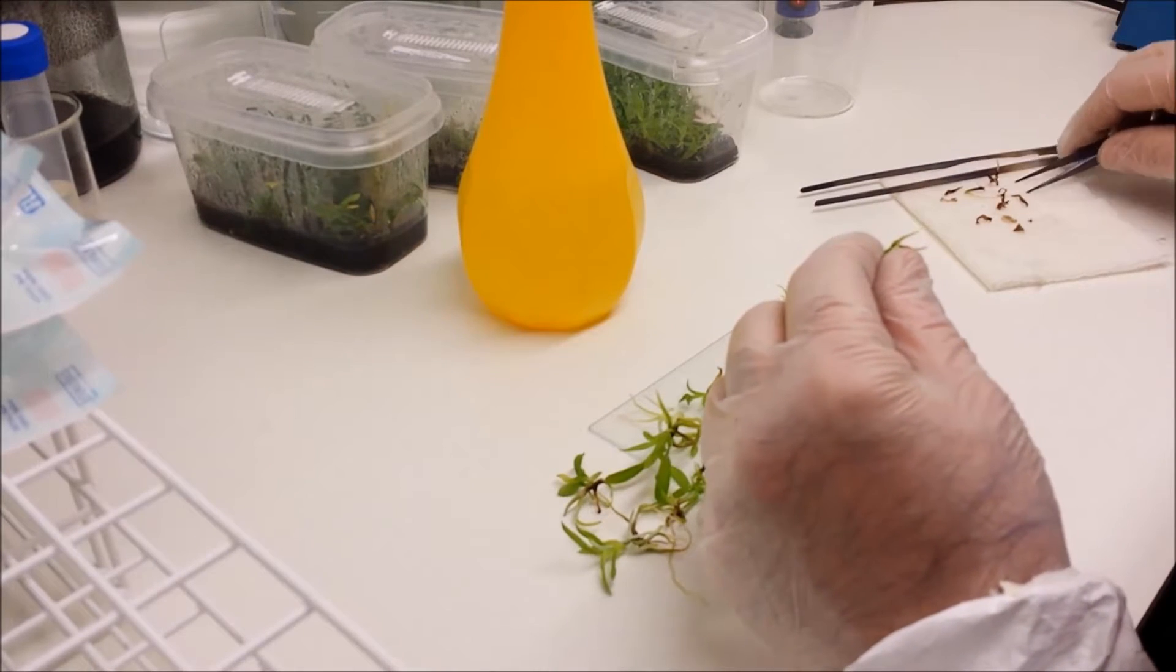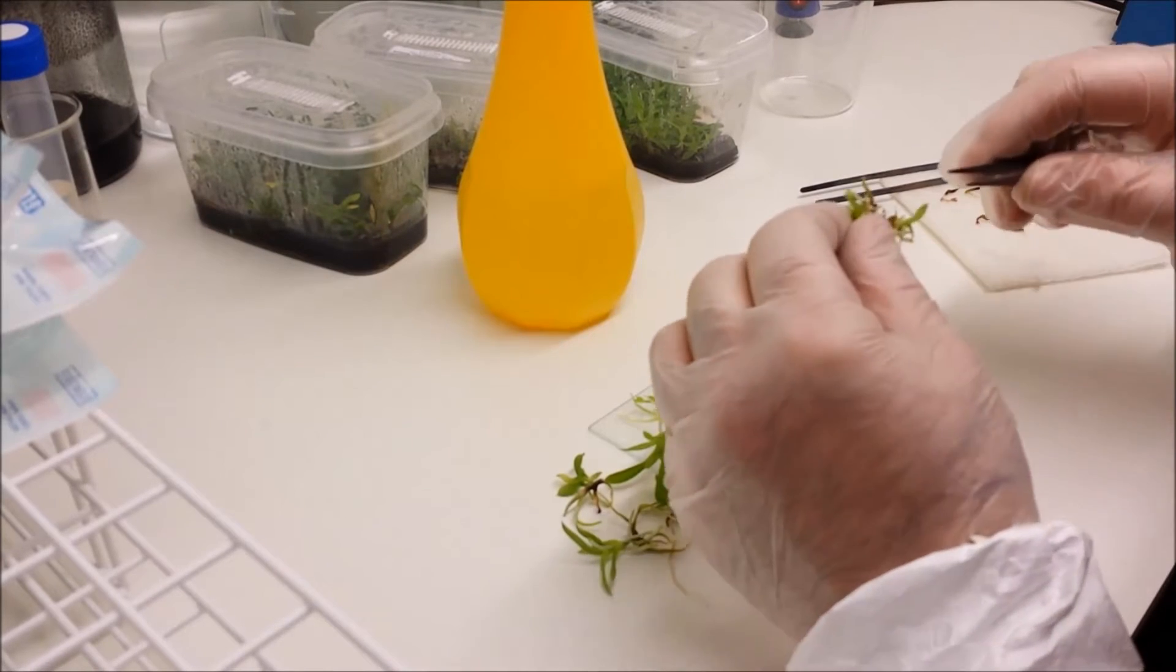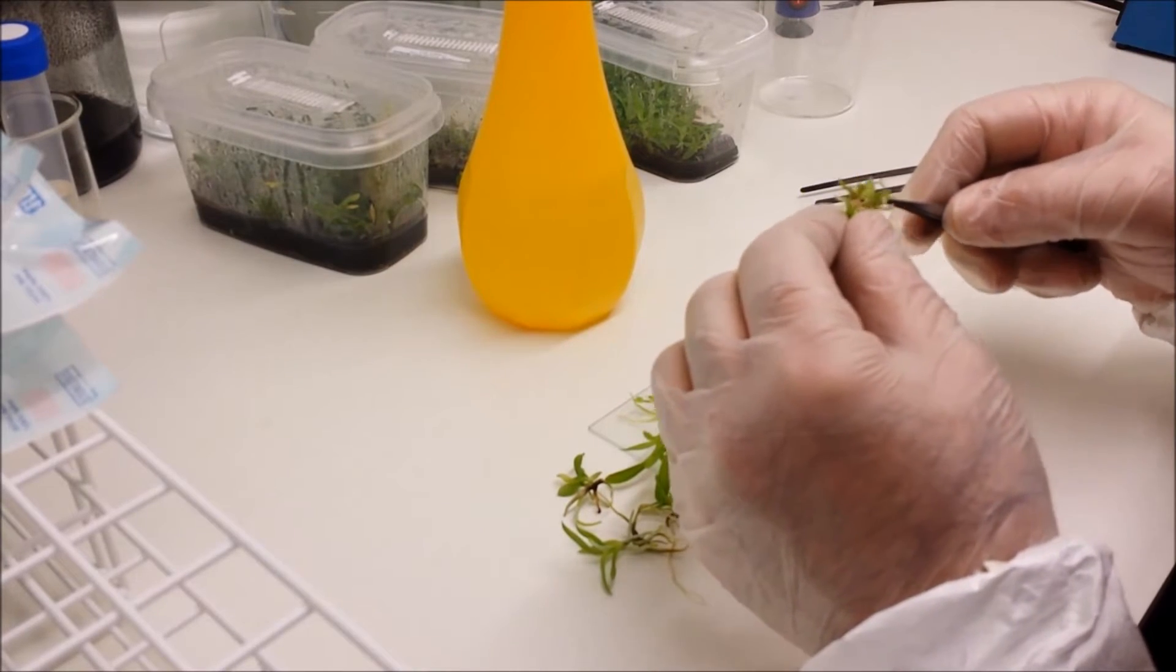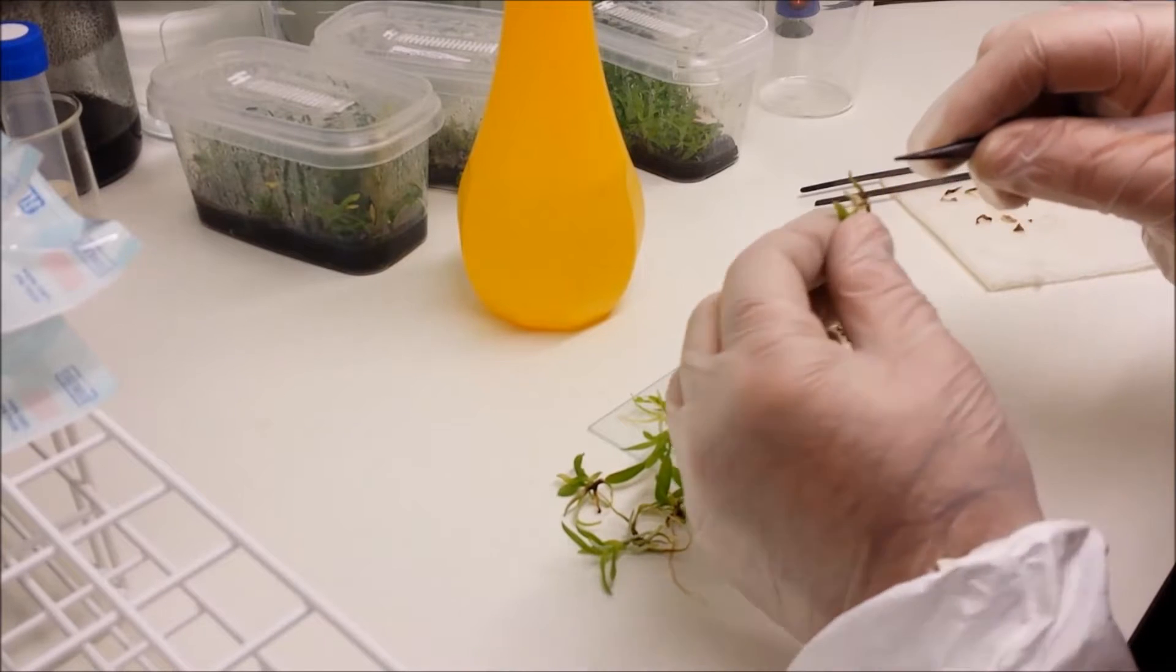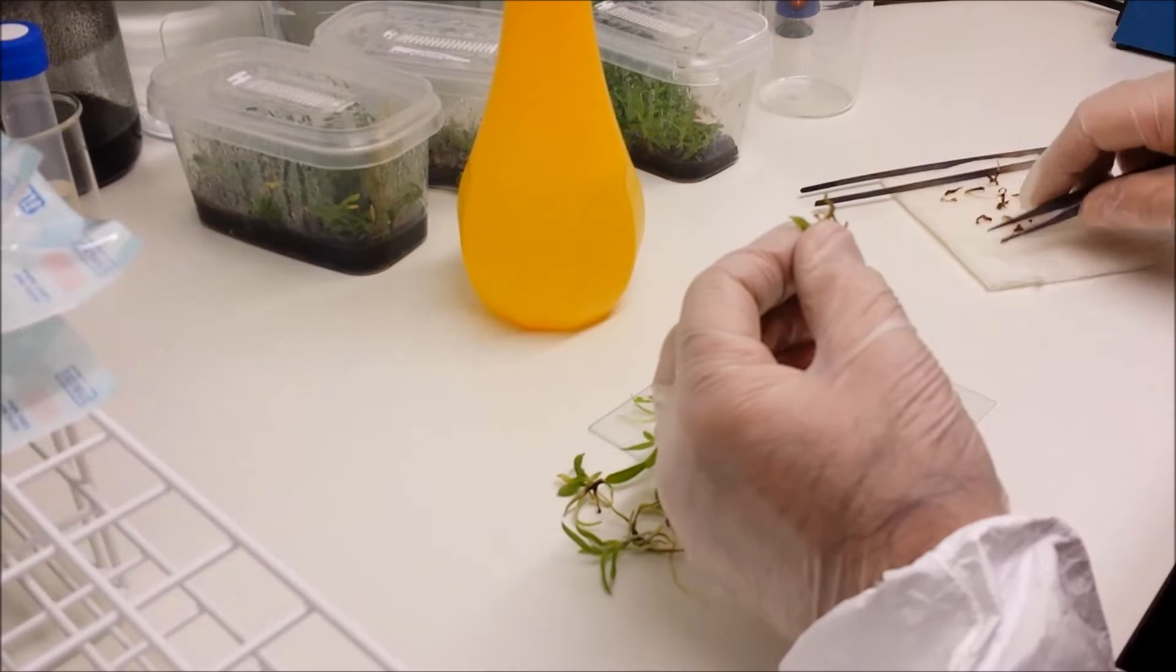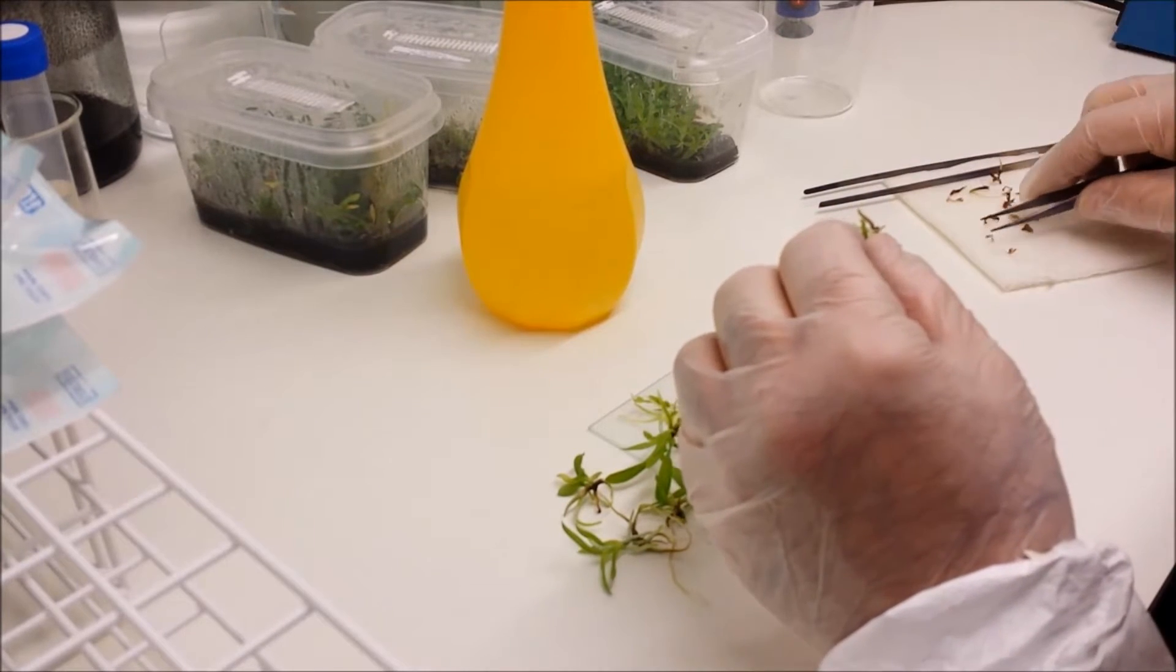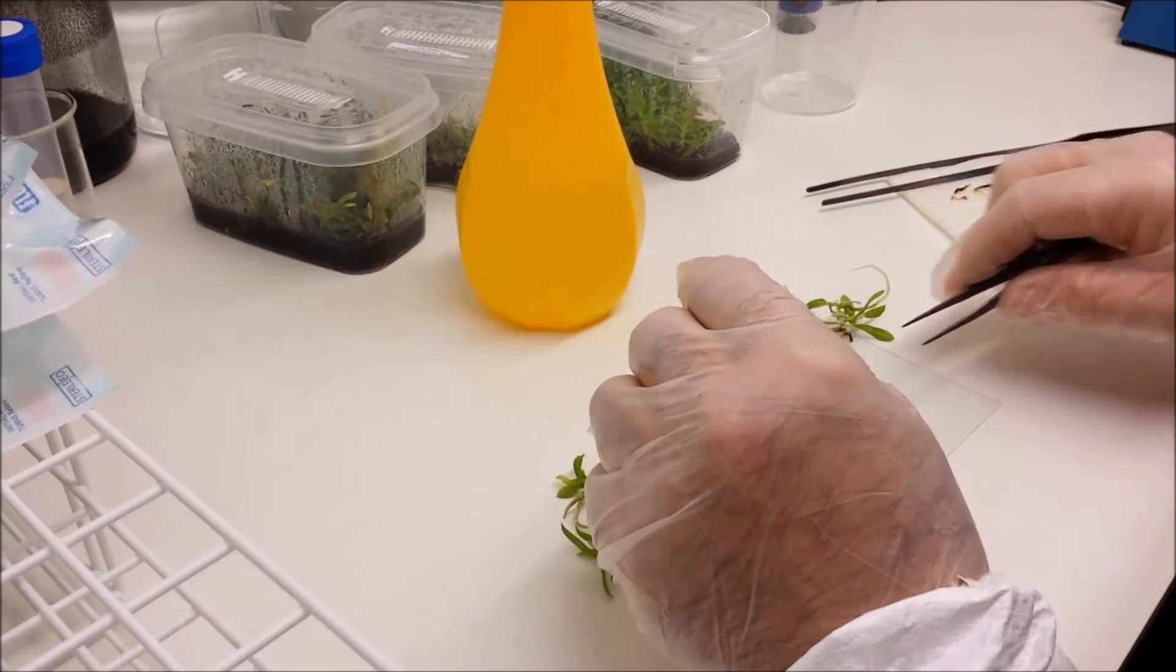So here we go. You see as I'm removing perhaps little dead seedlings from the base, dead bits of leaf. Take as much time as you need because you don't want to be rushing this. Because you don't want to apply too much pressure to the plant so as to damage the existing roots, the good roots.